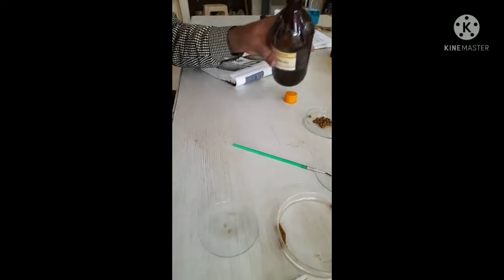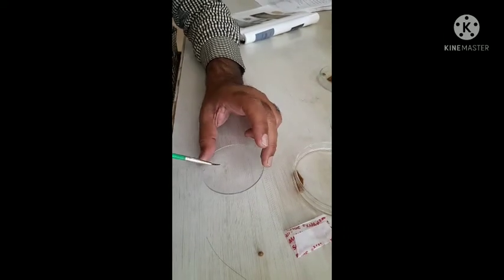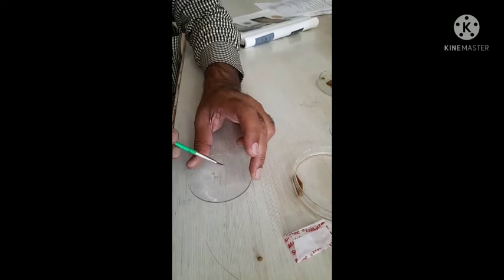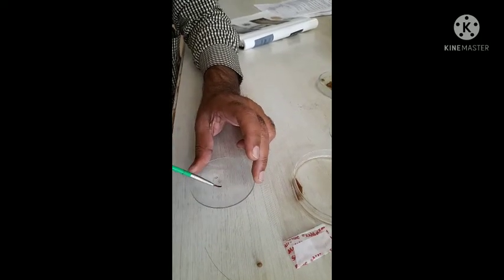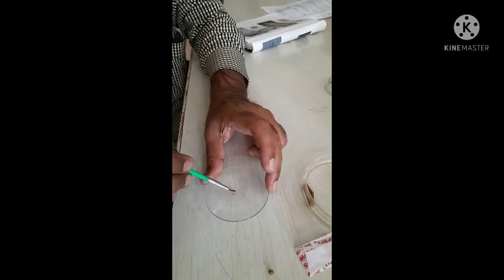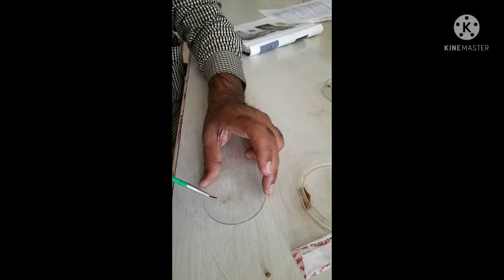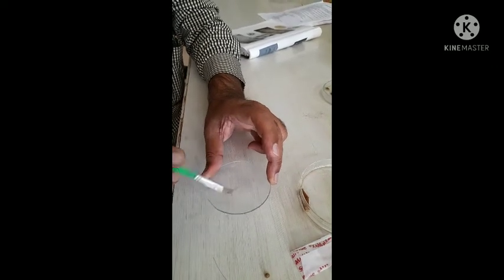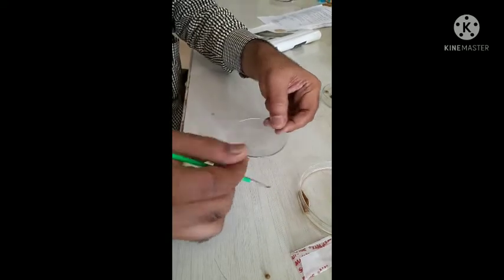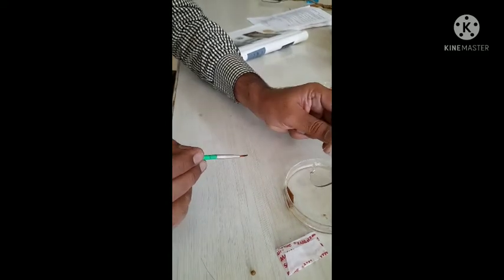Add 1 ml hydrogen peroxide on the section and treat the section for 5 minutes. After 5 minutes, remove the hydrogen peroxide from the watch glass. Then directly use specific microchemical reagents for staining. We treat with hydrogen peroxide and then remove the hydrogen peroxide from the watch glass.